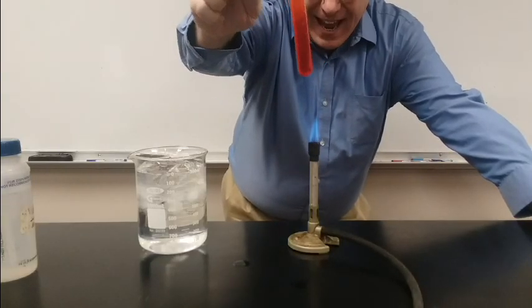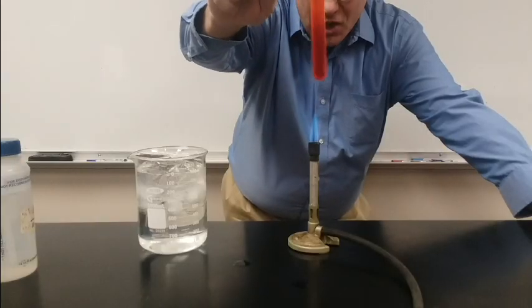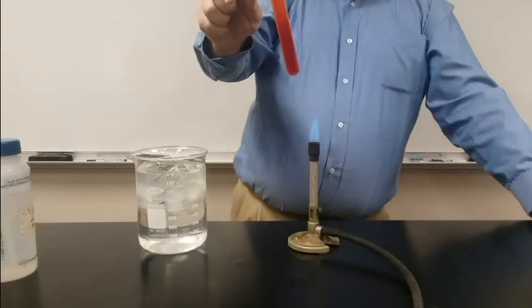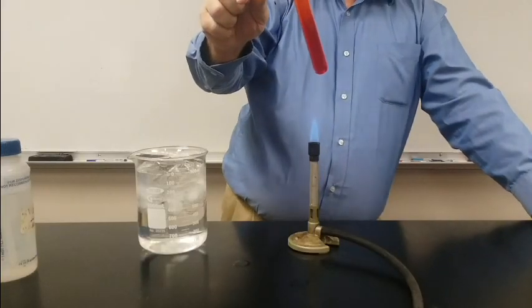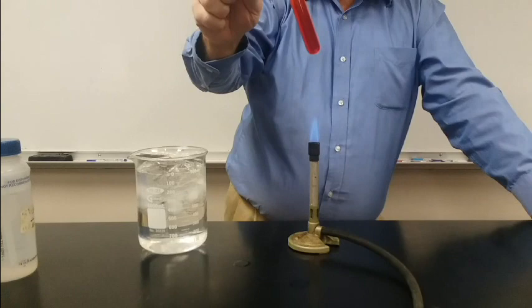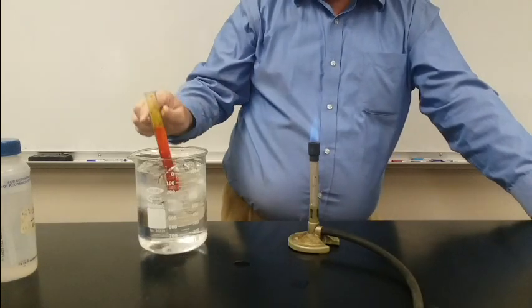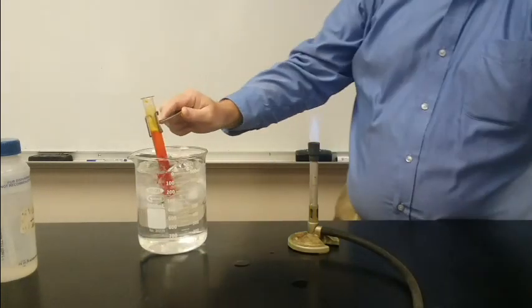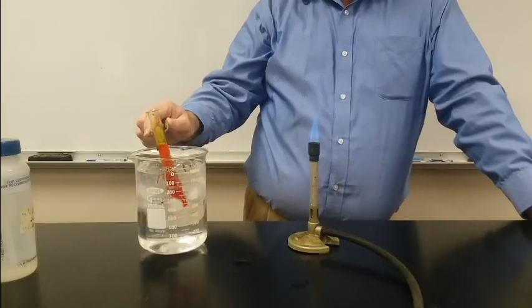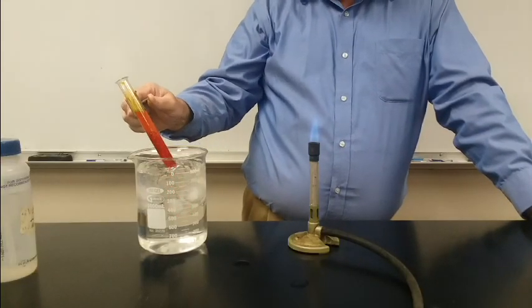As I heated the solution up, more solid dissolves. That's because the solubility of solids increases with increasing temperature. I can pull that solid back out of solution simply by cooling it. If I cool it, I'm lowering the temperature, and lower temperature means less solubility.